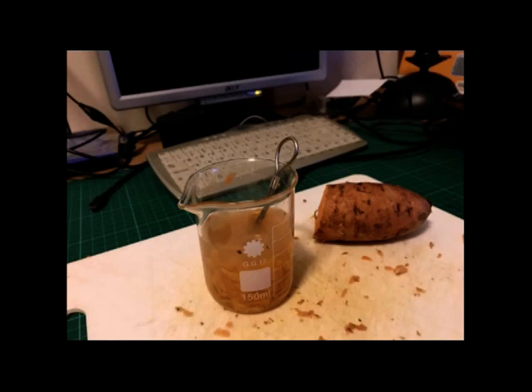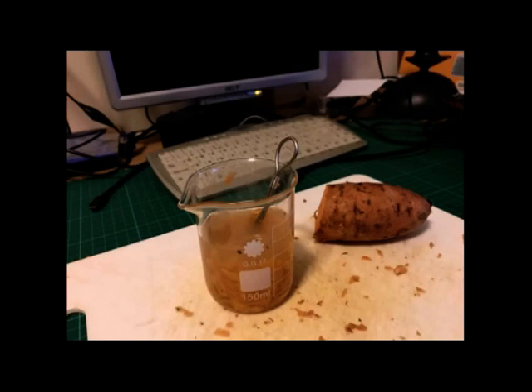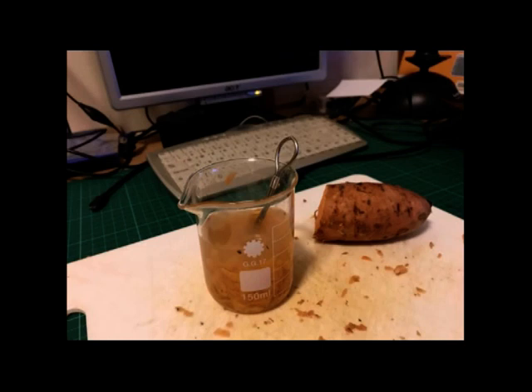Firstly, you must prepare a starch solution so that we will know when the diffusion reaction has taken place. To do this you will need to grate the potato, put 25ml of that potato into the beaker, fill the beaker up to 100ml of boiling water and then mix it.